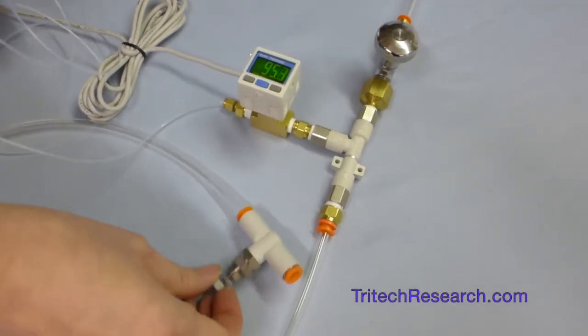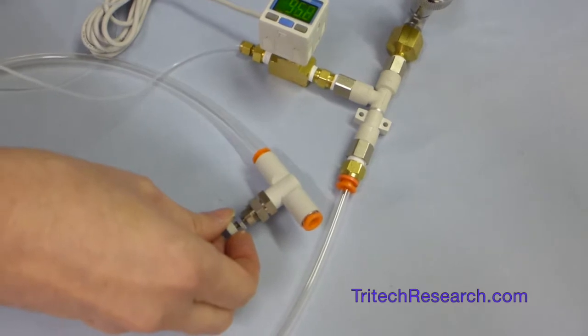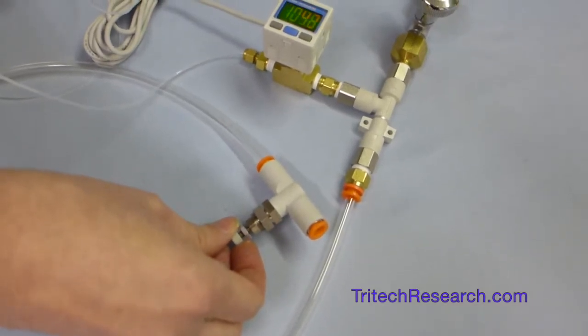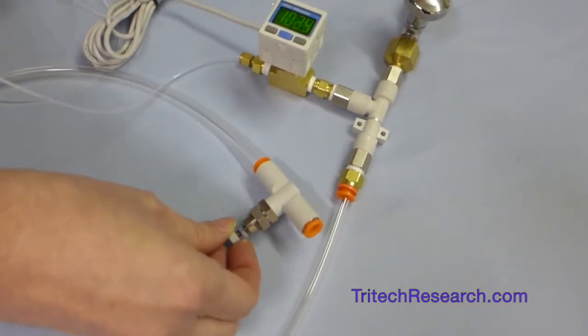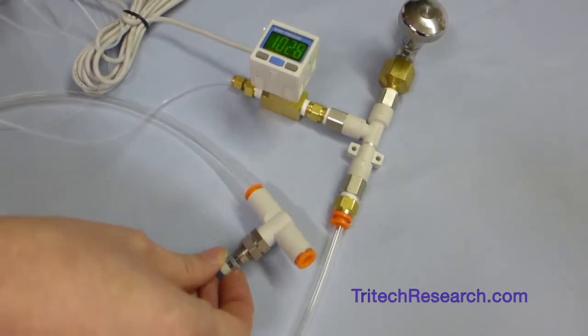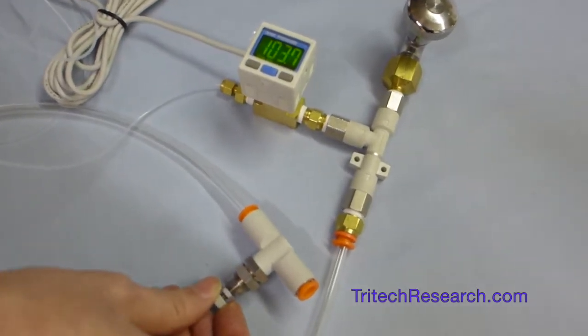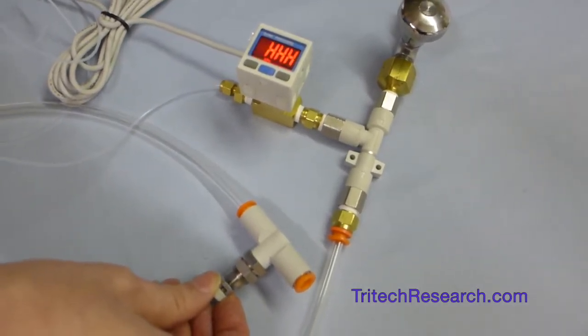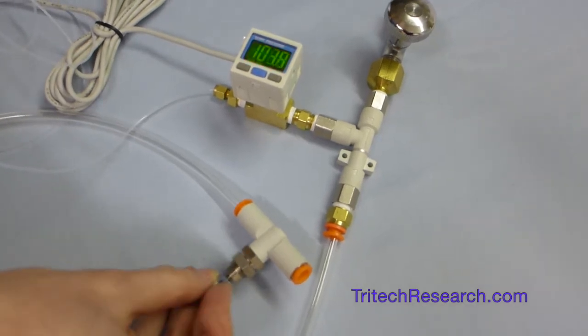And this unit is only set to show about 100 and something kPa. And then it goes over the scale there. So it'll go up to 105 kPa. Of course, the pressure can be much higher than that, but it can't measure it.